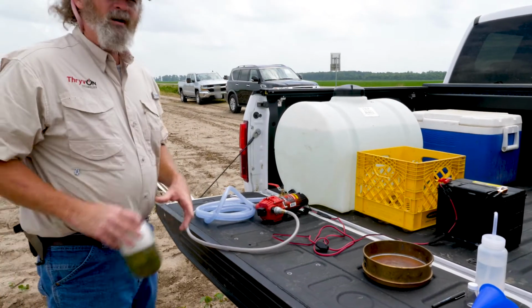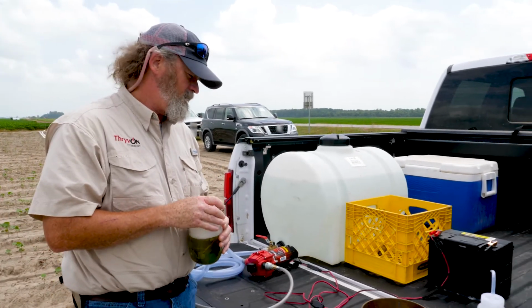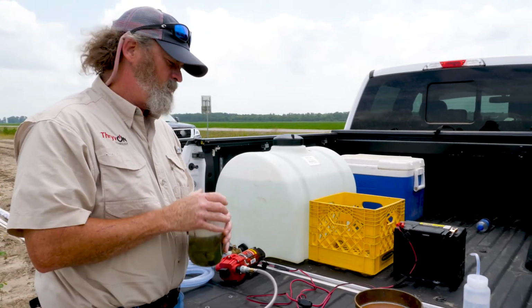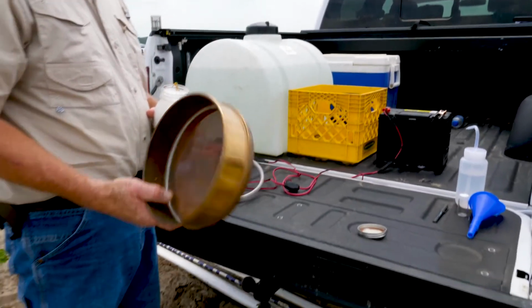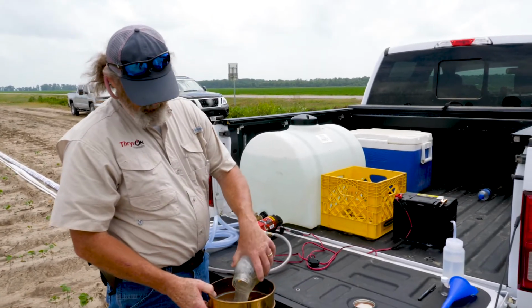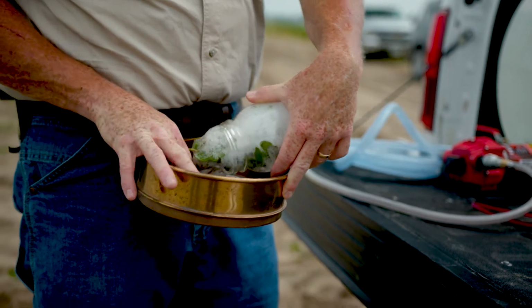So now here we are at our homegrown processing facility, and you see it's not anything terribly sophisticated. Plants have set an adequate amount of time, and we're going to collect the insects from the plants and prepare them to count them inside. So what we do is take a soil sieve, soil screen, this is a 100 mesh soil screen, pour the plants and the solution through the screen.